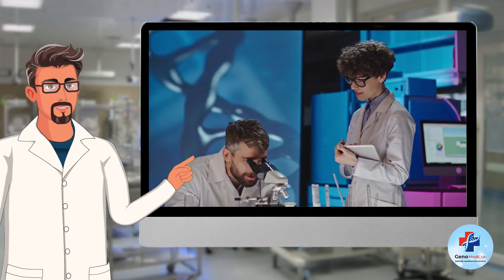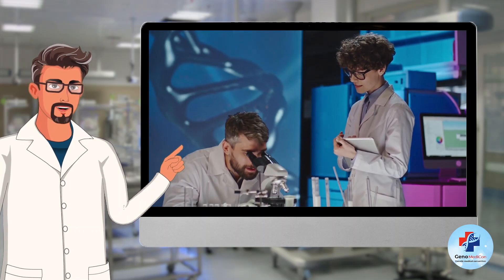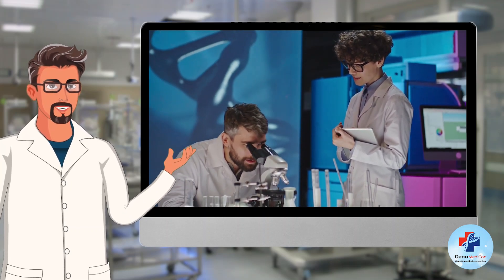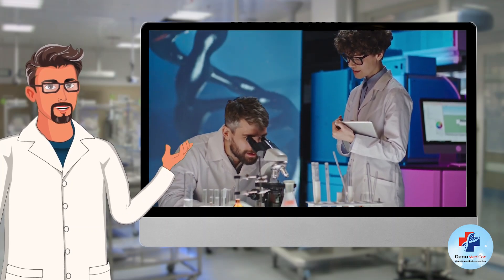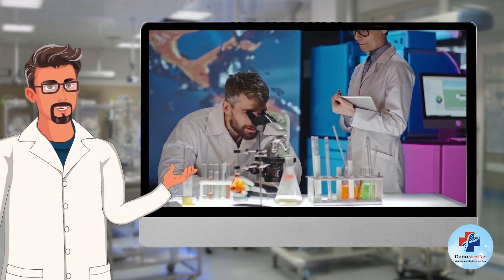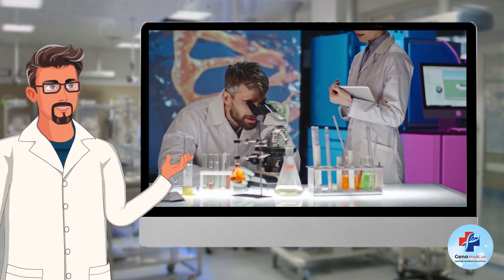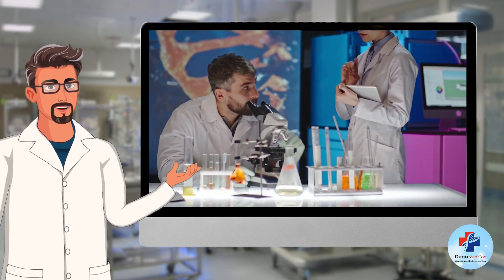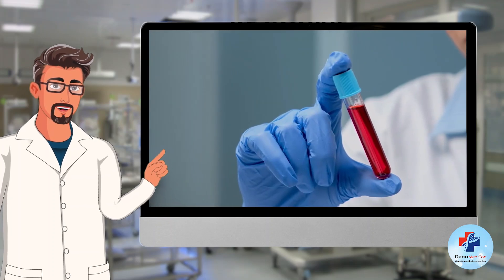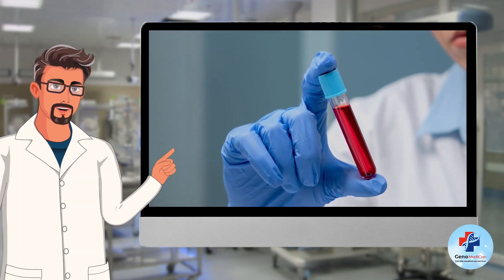Imagine you're in a genetics lab and you want to perform a genetic test — whether it's a simple polymerase chain reaction, microarray, or even high throughput sequencing. Regardless of the specific tools and reagents used in each method, all of them will require a genetic sample of the subject.